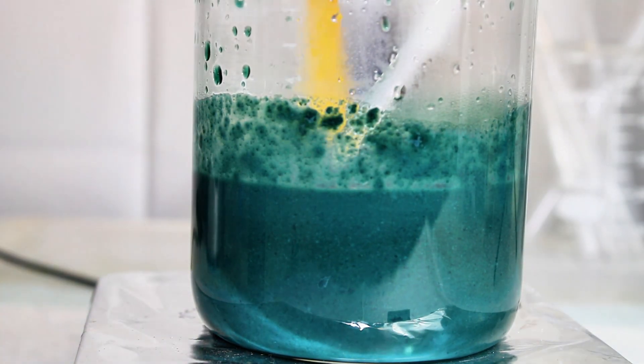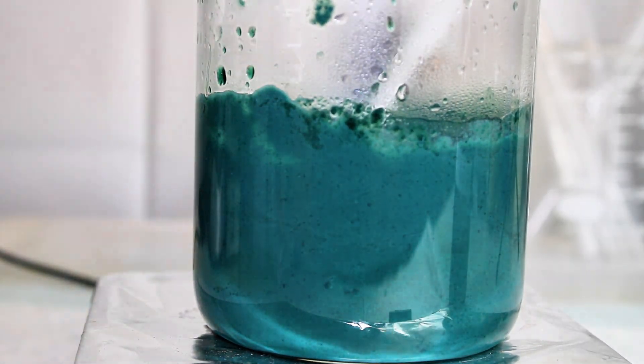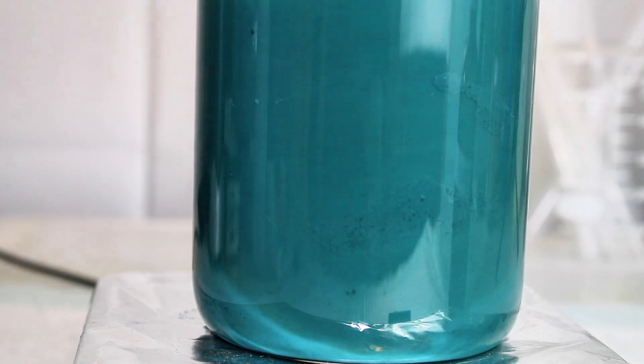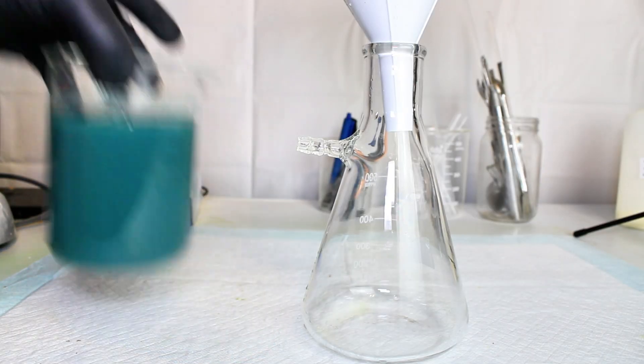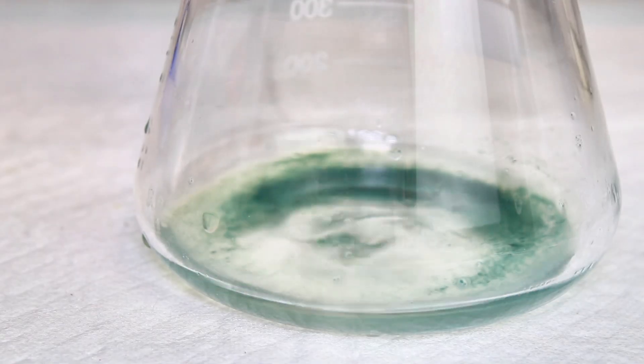Anyway, once all the chromium hydroxide had precipitated, I went ahead and filtered off as much water as I could and transferred the wet gooey globs of chromium hydroxide to a new beaker. As a side note, chromium hydroxide doesn't really filter or dry easily at all, and it's kind of a nightmare to work with.